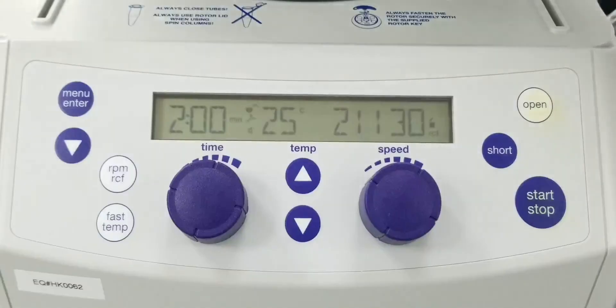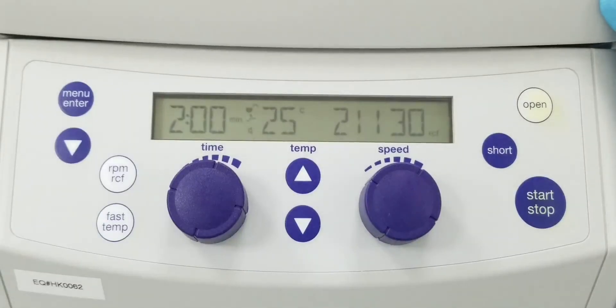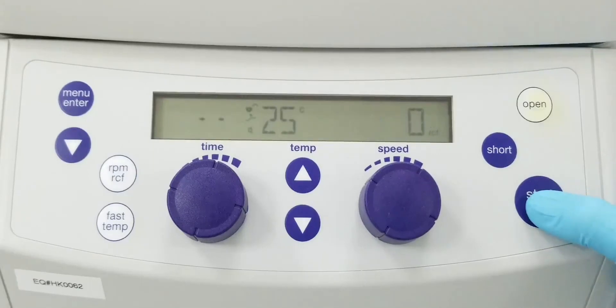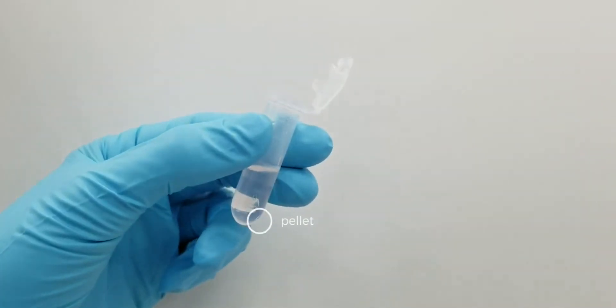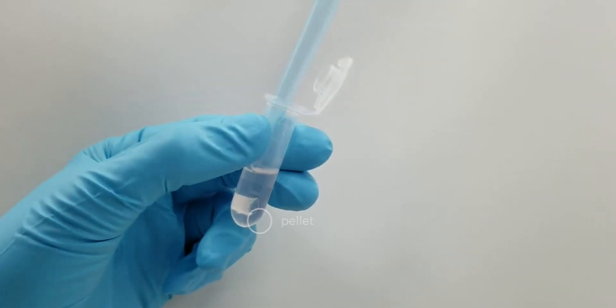Add 1 milliliter of 40% isopropanol to the tube and centrifuge at max speed for 2 minutes. Carefully remove all of the supernatant and avoid disturbing the pellet.